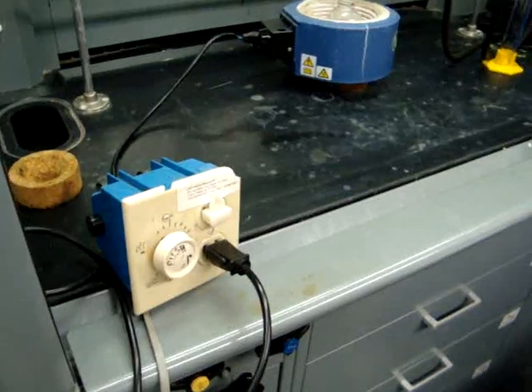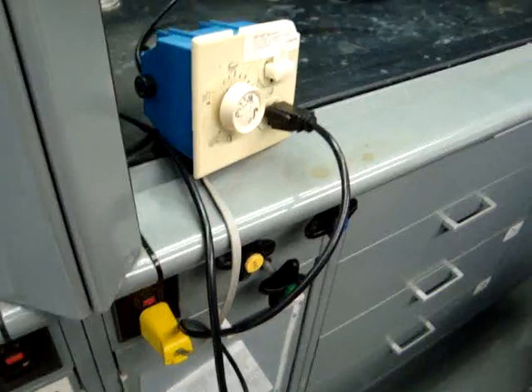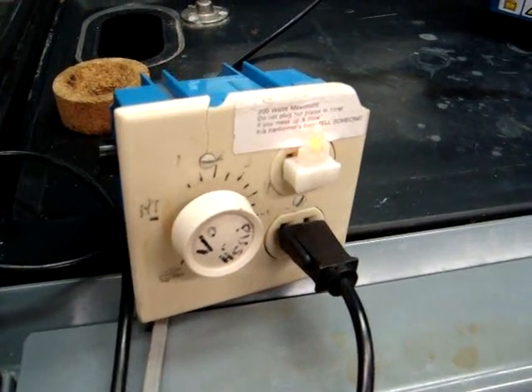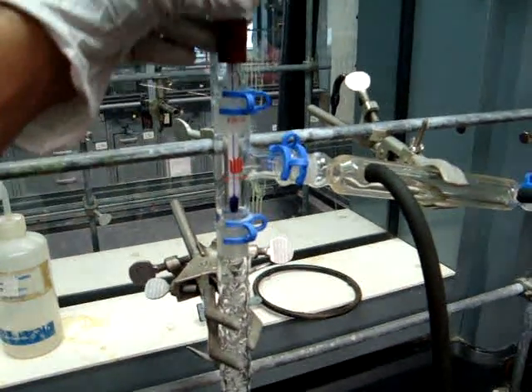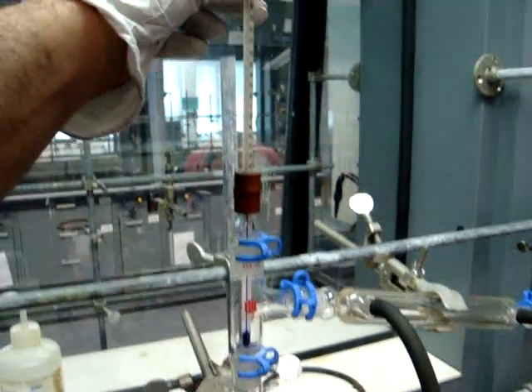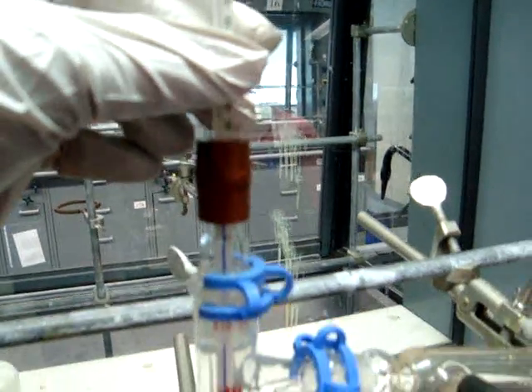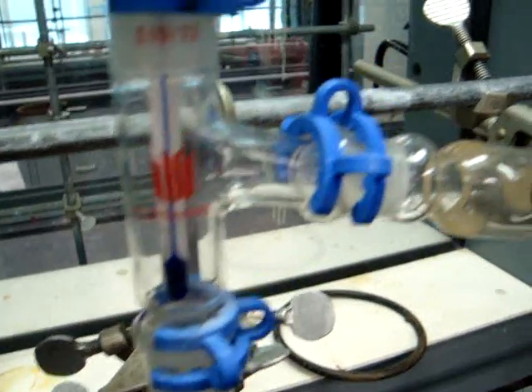You'll be putting your heater on a cork, which will make it easier to remove at the end. Connect the heating mantle to the transformer, which will then be connected to the outlet. Make sure your transformer works by plugging it in and turning it on to see if the light appears. Next to the fractional column is the distillation head, and above that is the thermometer adapter and the thermometer. Make sure the thermometer scale is positioned so you can read it, and that the tip of the thermometer is all the way down to the end of the distillation head, below where the condenser will attach.